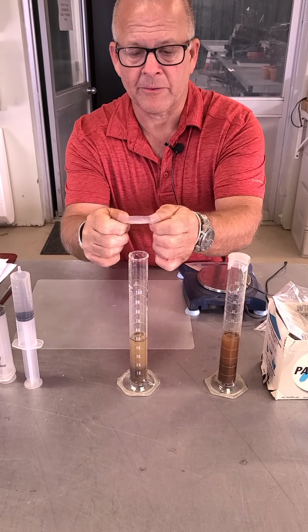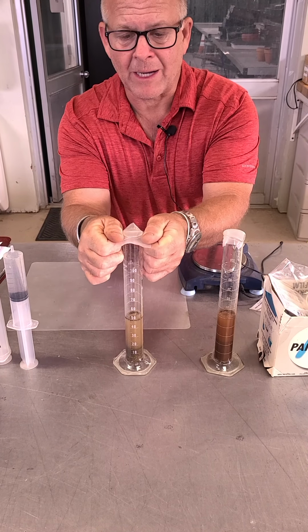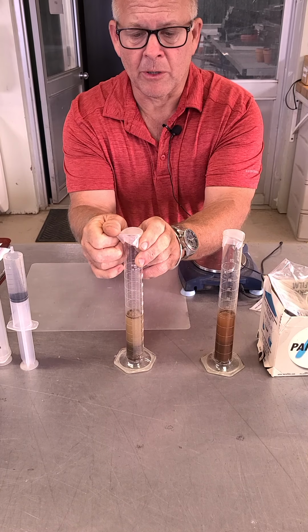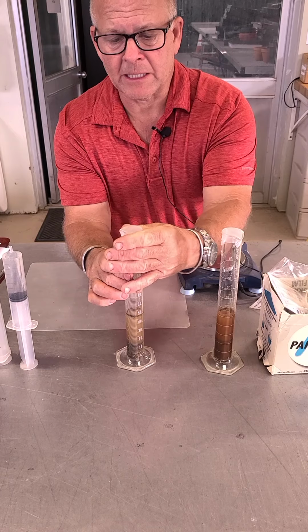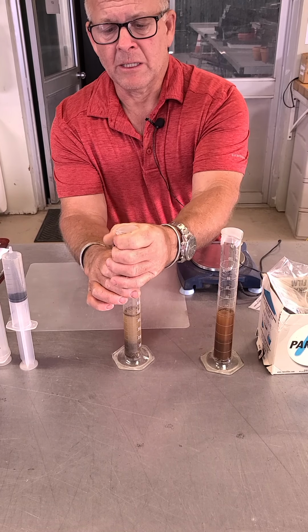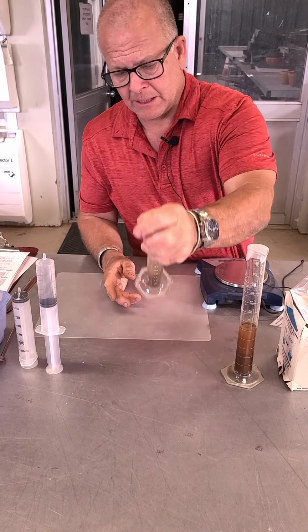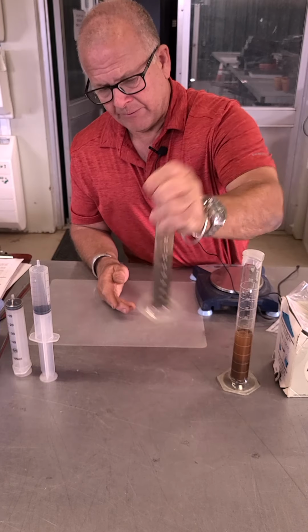So what I'm going to do is, this stuff is actually kind of stretchy. If you're careful, you can stretch it. It's like really thick, waxy cling wrap, if you will, and it'll stick to this. If you pull it too hard, it doesn't really stretch too much, but if you do it just right, you can actually make a nice seal on it and then push the edges down. So now I've got that seal. What I can actually do is, if I dare, I can shake this thing up, and it won't leak if I've done it right.